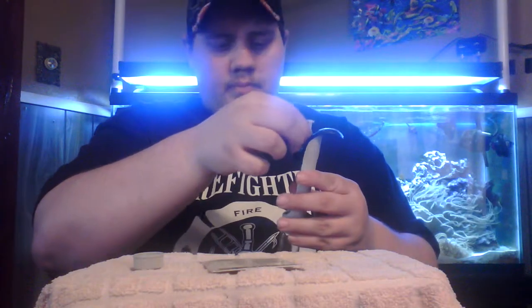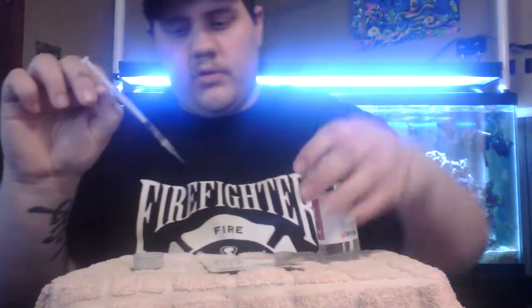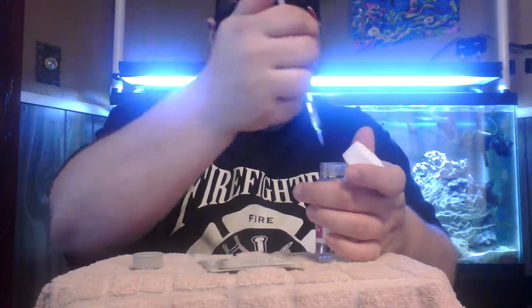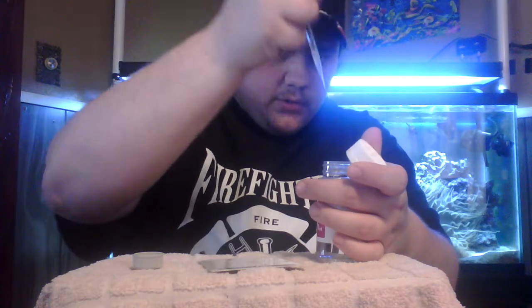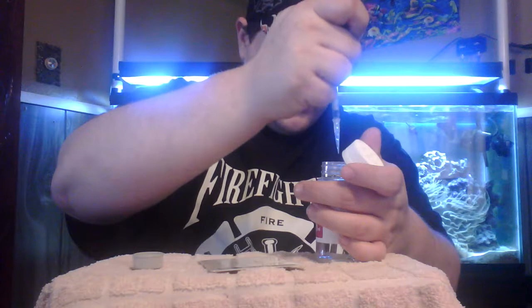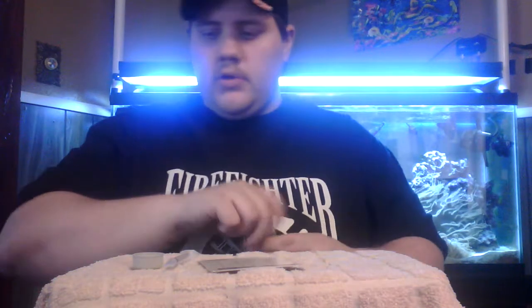When you're done, take your syringe out of the titrator. Whatever reagent is left — don't put the tip into the reagent bottle because there might be contamination on the outside. Just squirt what's left in there into your bottle. Close everything up — and that's how you do your magnesium test on the Magnesium Pro test kit from Red Sea.